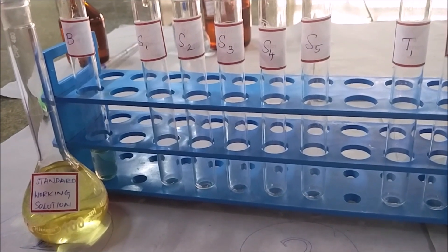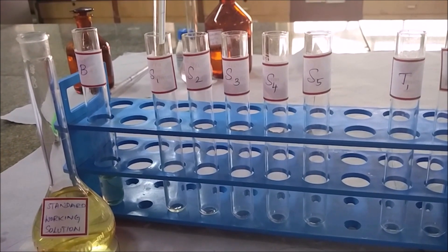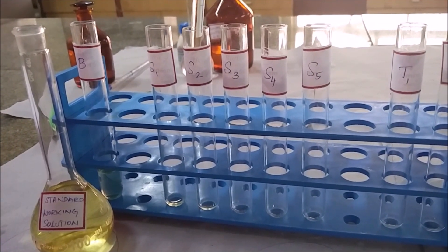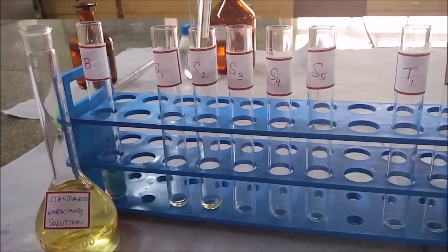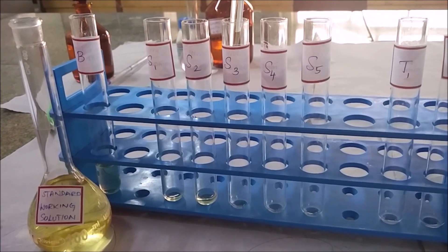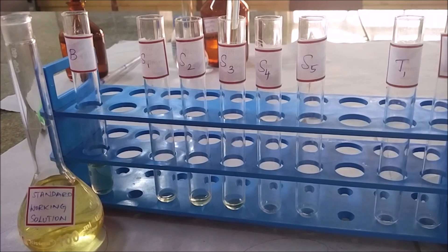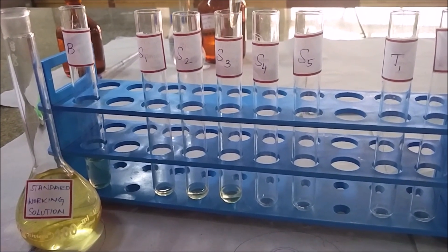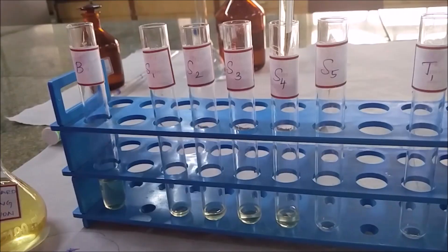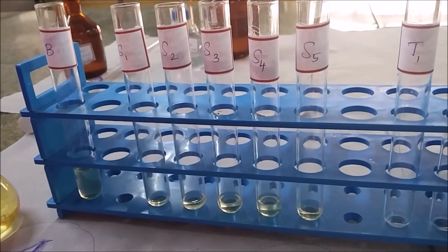Different concentrations of standard working solutions are taken in the series of test tubes. In S1, 0.5 ml of the standard working solution is taken. In S2, 1 ml is taken. In S3, 1.5 ml of the standard working solution is taken. In S5, 2.5 ml of the standard working solution is taken.